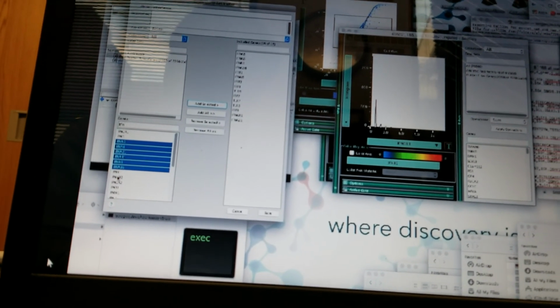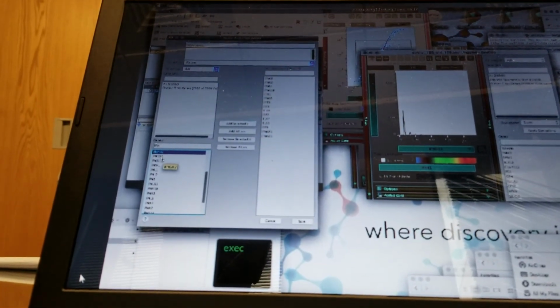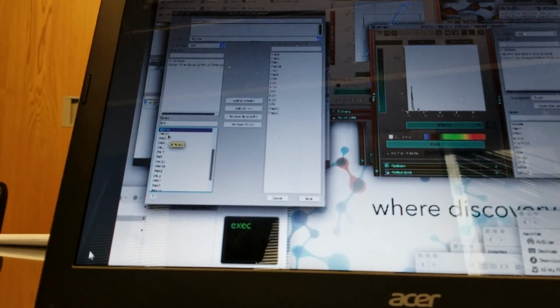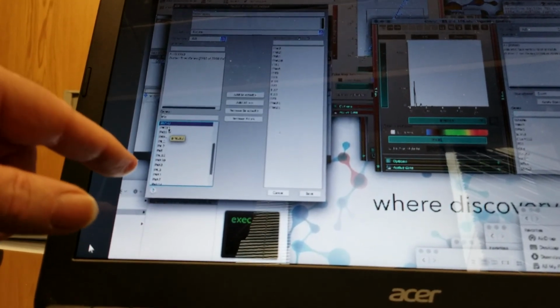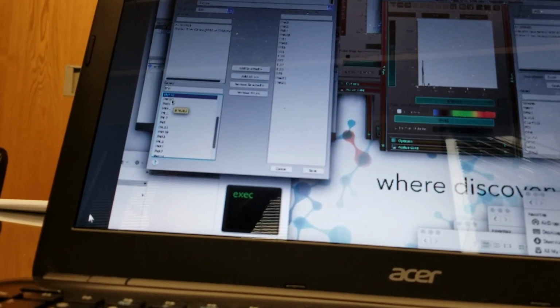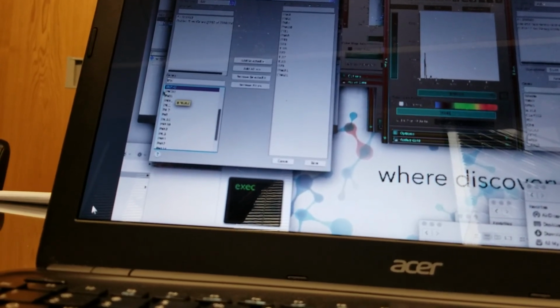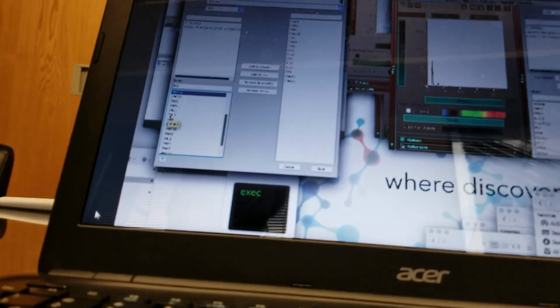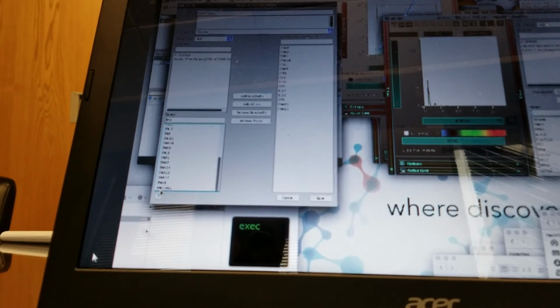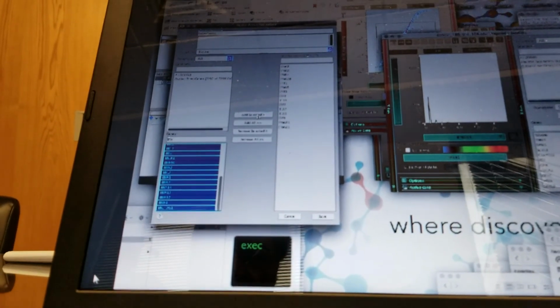I can't read the lower ones there. I can't see it well. There's IFN alpha 2. Right, we want any of the IF. Yeah, so these are all under the filter IFN, but then there's IFNAR2, IFNGR2. Did you say anything with IFN? Yeah, I think so for now. There's an IFNA2. Oh, here's 17. Right, that's a higher abundant one. So any of those for now. Right, any of those. Let's try that.